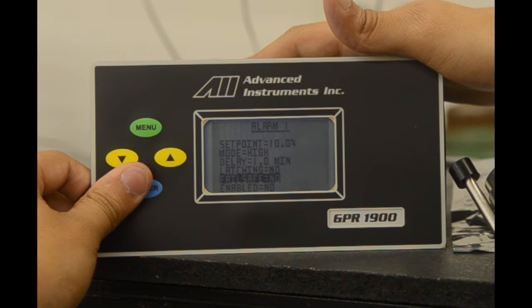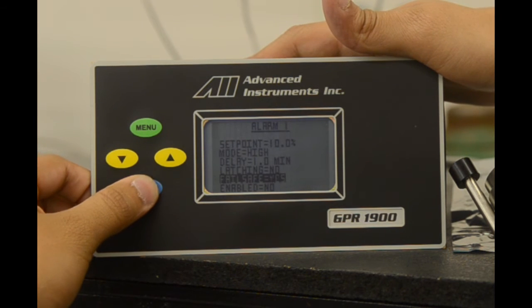We also have a failsafe option. Currently, failsafe is no. However, again, enter to configure the alarm relay to be in failsafe mode.